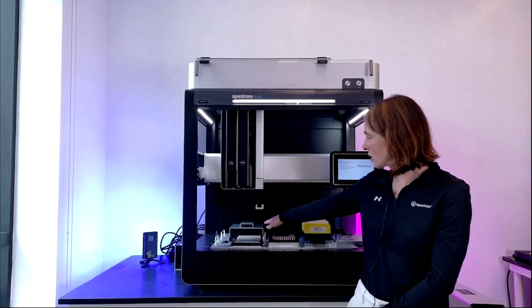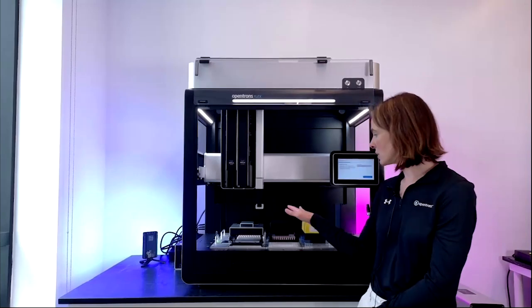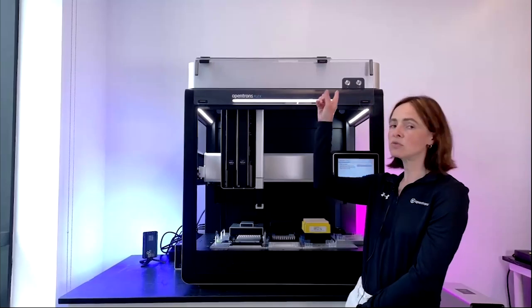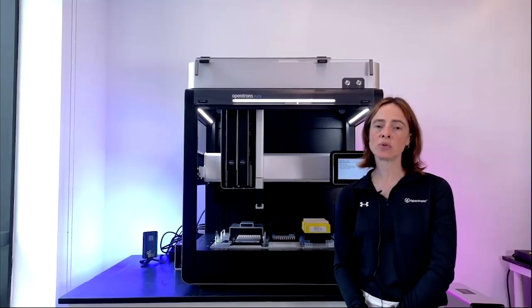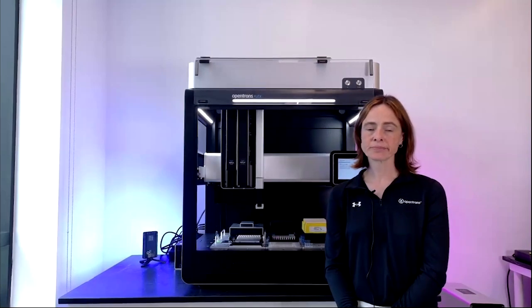And at the back, you can just see the lid here, is the Opentrons thermocycler, which can automatically open and close using the software. And so it's a really unique option for automating PCR and other workflows. And finally, I mentioned at the beginning, we just recently launched this HEPA UV accessory that sits neatly on top of the robot and allows you to sterilize the deck surface and also filter contaminants from the working area.